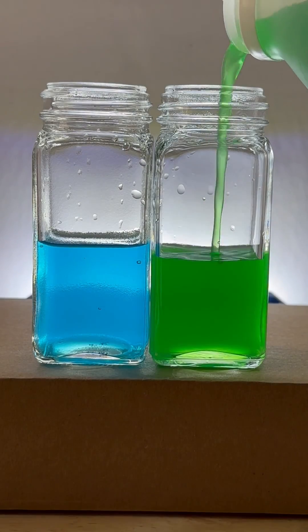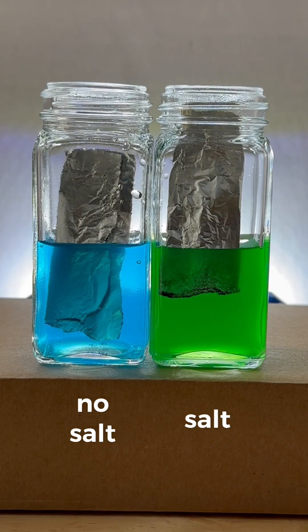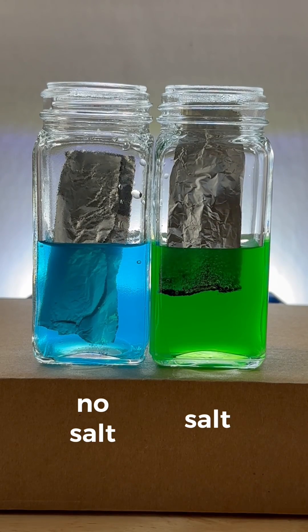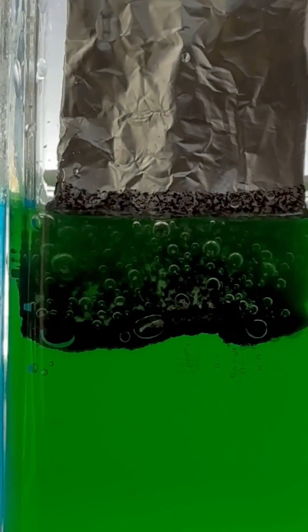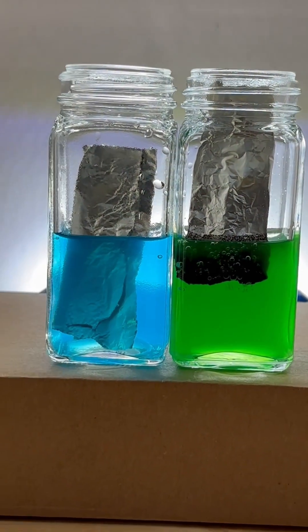Let's see how both of these solutions react with some aluminum metal. Hey, maybe something's going on. Let's zoom in to take a closer look. Yep, in the copper solution that contains salt I see some sort of chemical reaction going on.